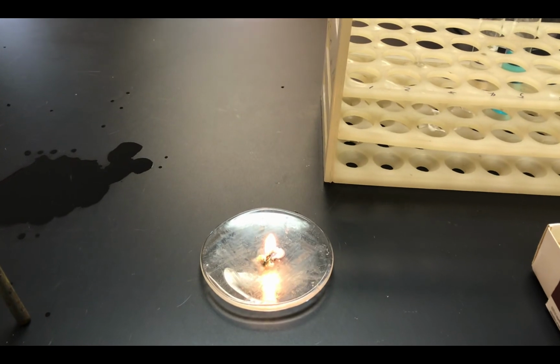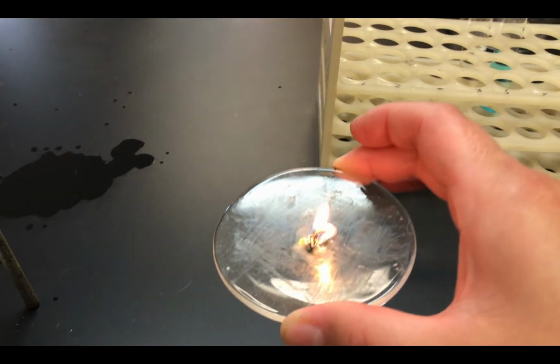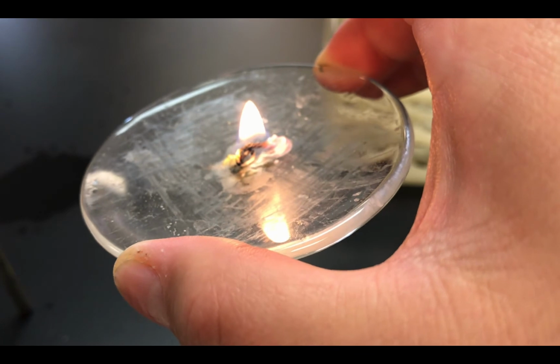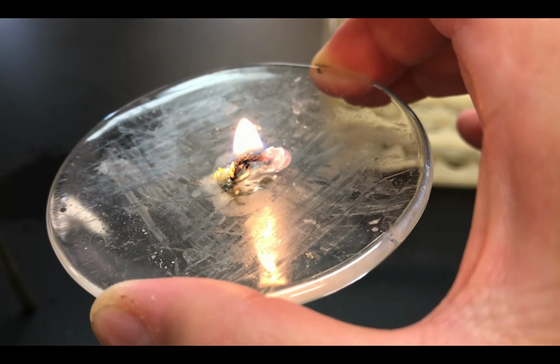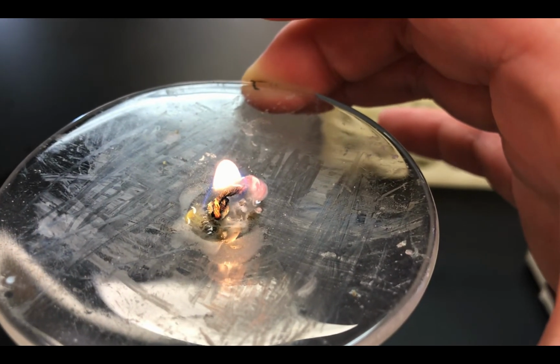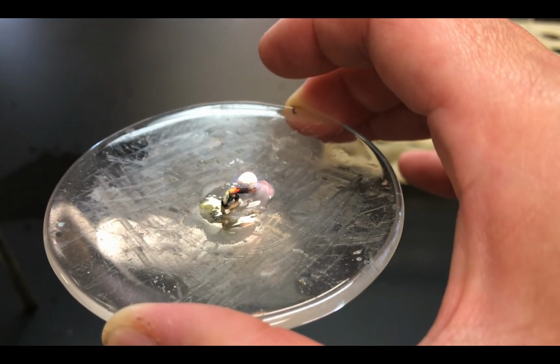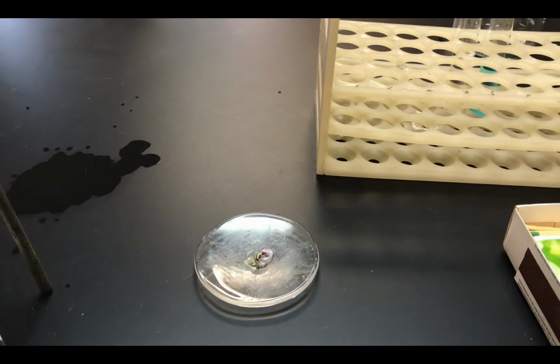All right, let's go back to that candle, demo number 2, because obviously things that keep occurring should be revisited over time. So here we are, and clearly things are different than they were before, so make sure you have some good notes about what you see, and don't forget to include what you don't see that perhaps you may have anticipated seeing, right? So take good observations. This is what demo number 2 looks like several minutes later.